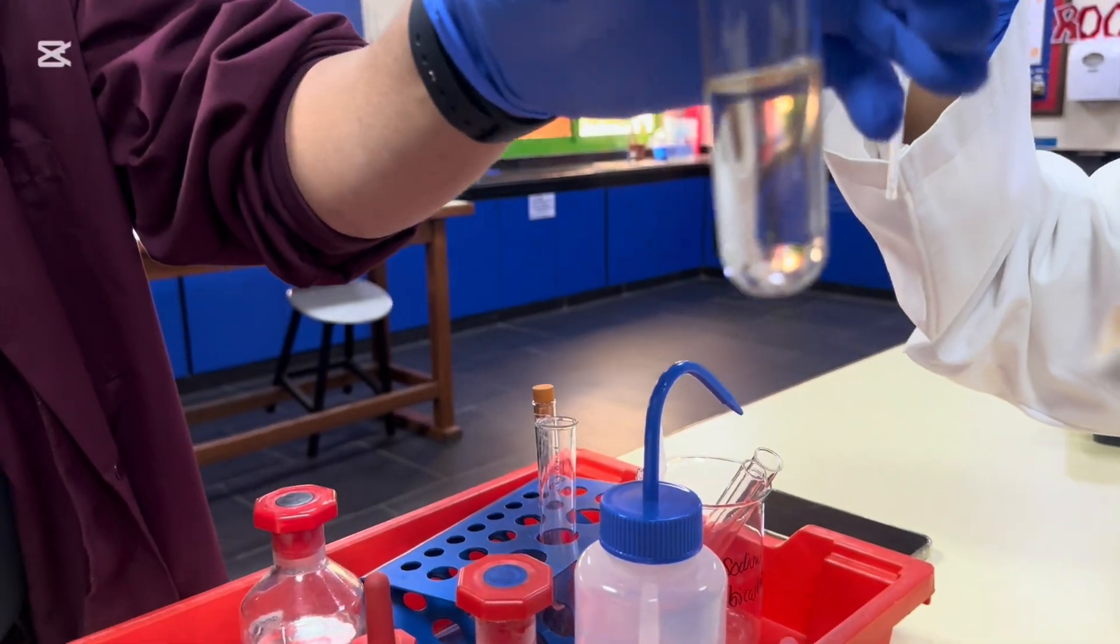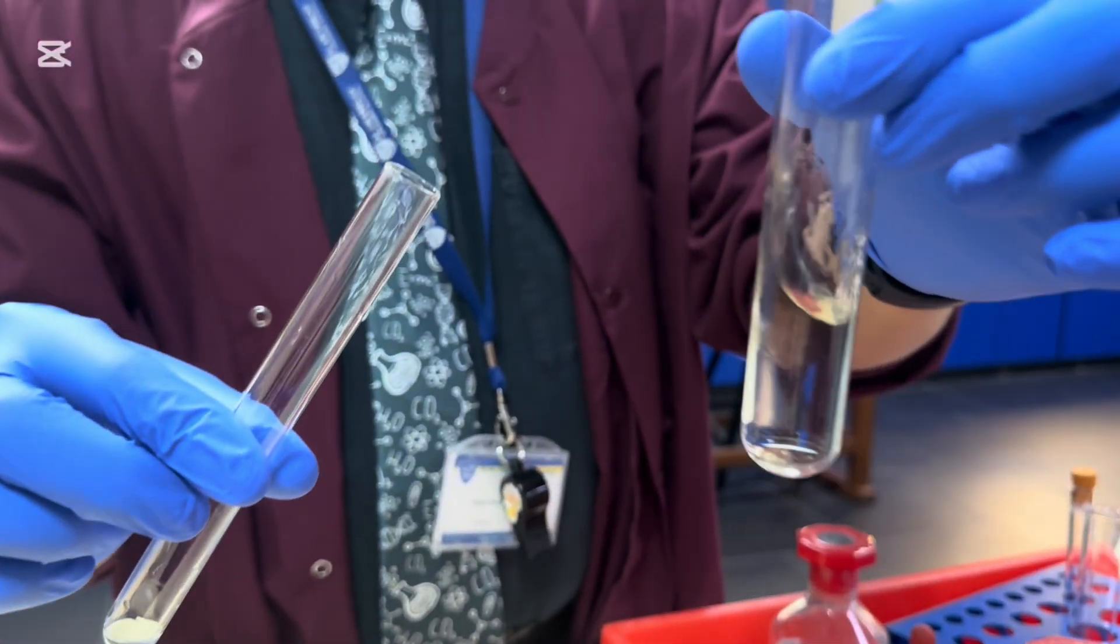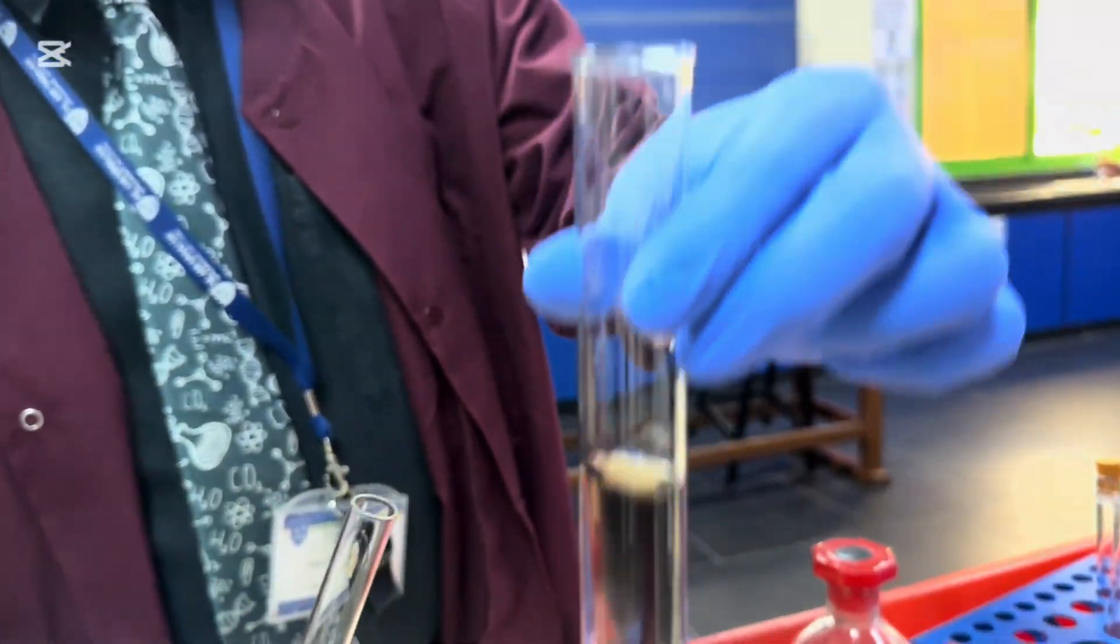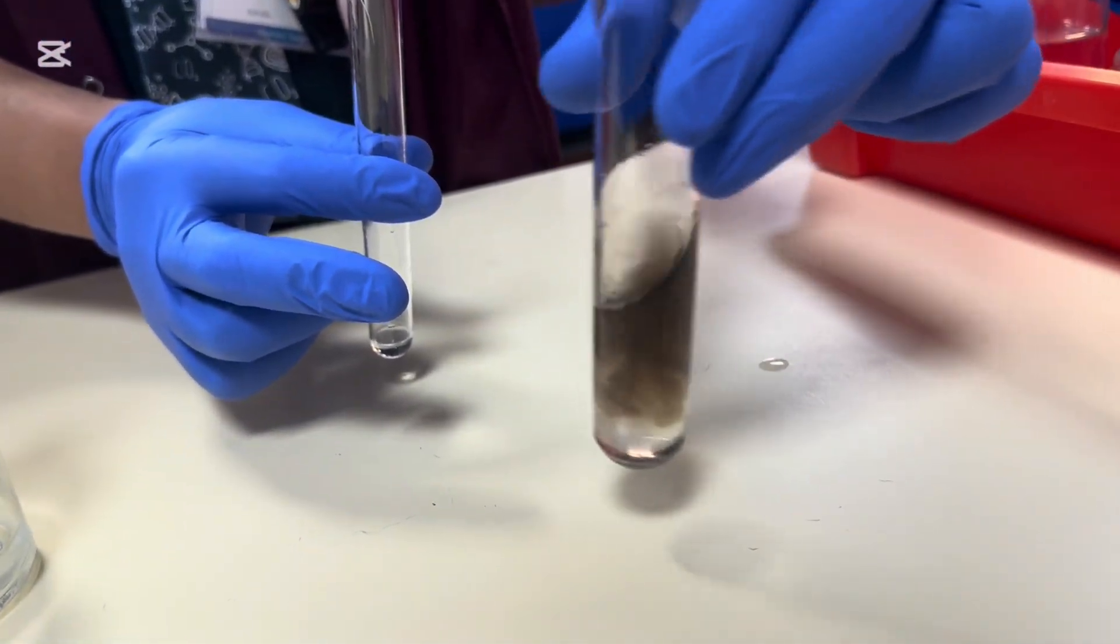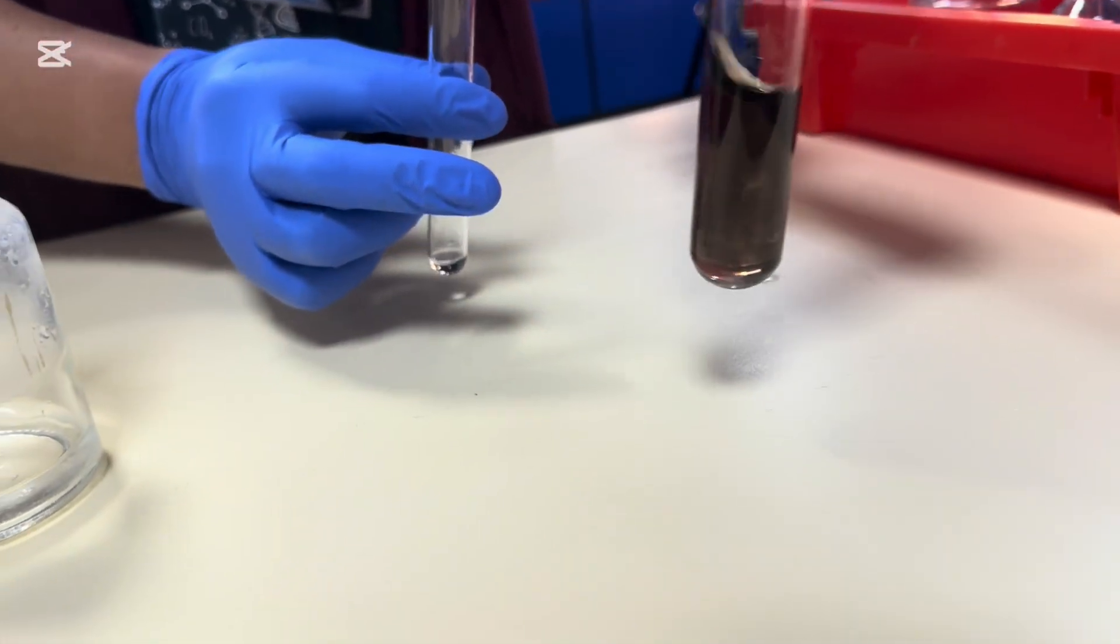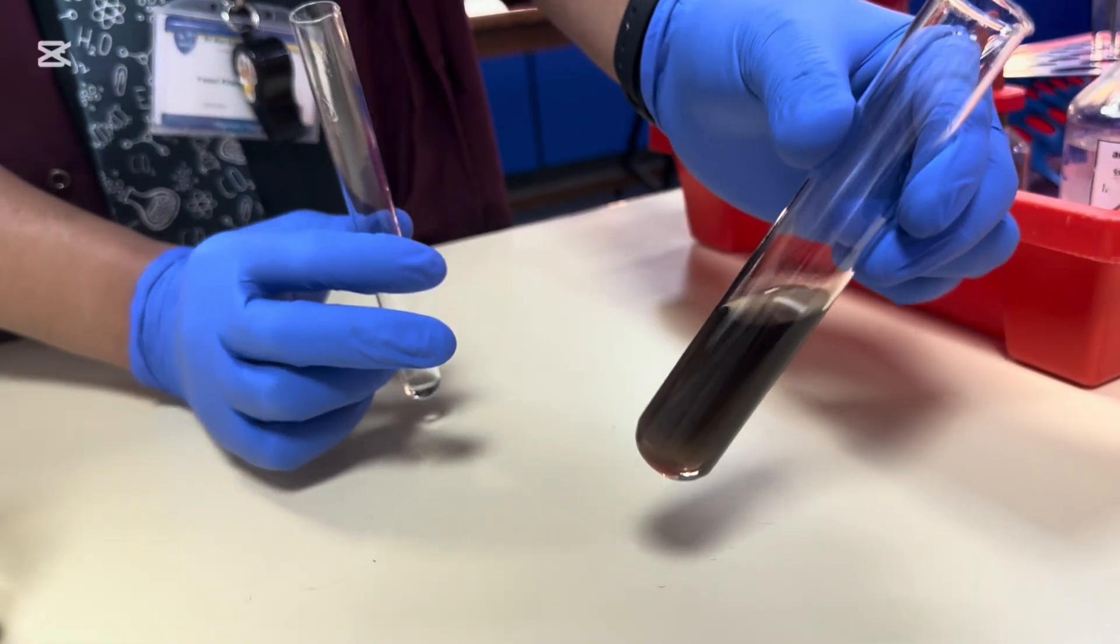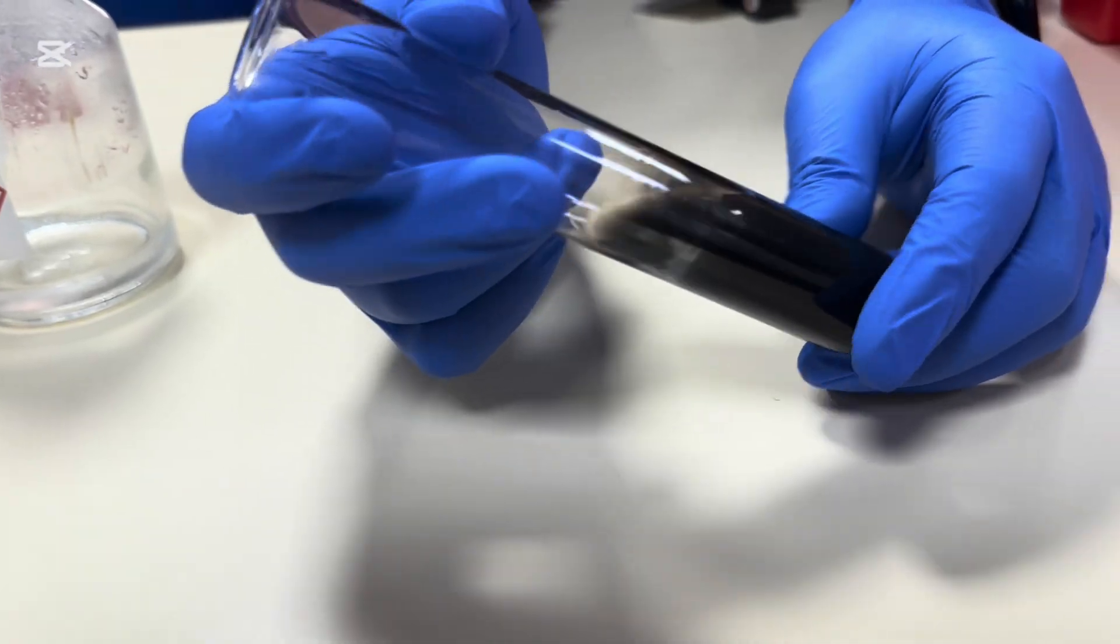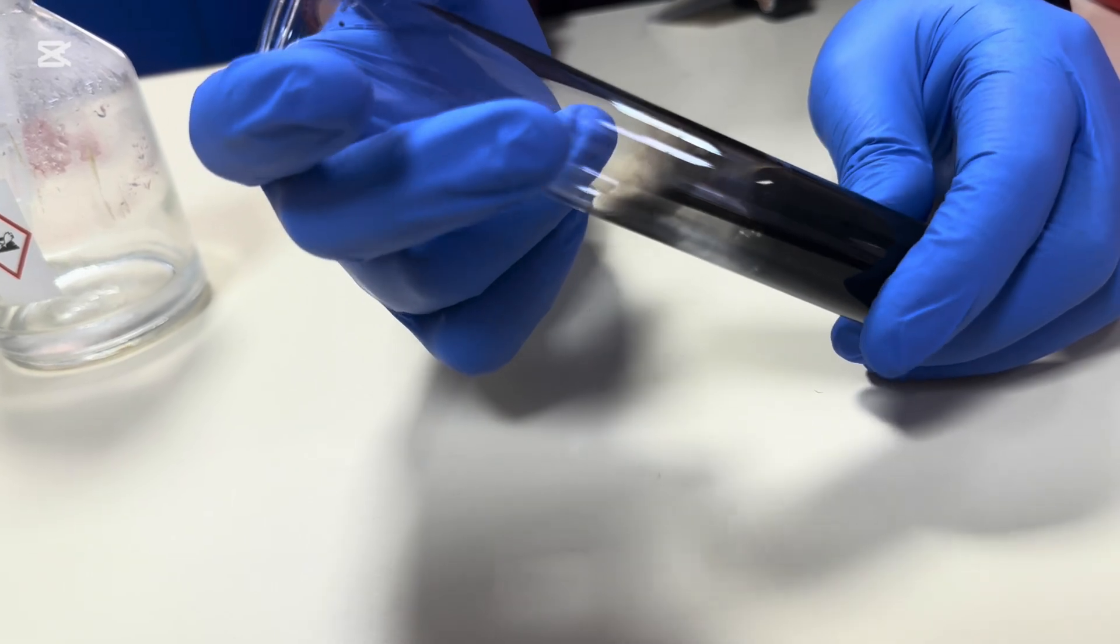Is it doing it? Nothing's happening. Nothing's happening. Appears that nothing is happening. Oh. Okay. So it's definitely getting darker. You can see it against the table. Okay. Definitely something happening. So it goes black is certainly an observation. It could potentially say that there is a precipitate at the bottom. Oh, that's very black. Okay.